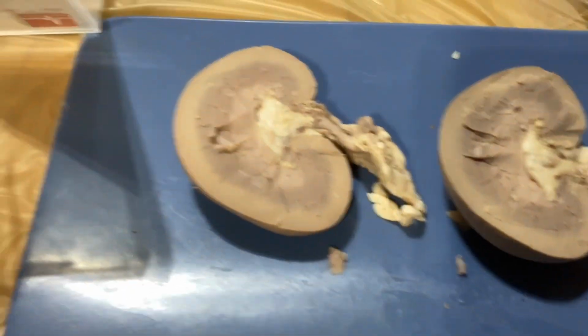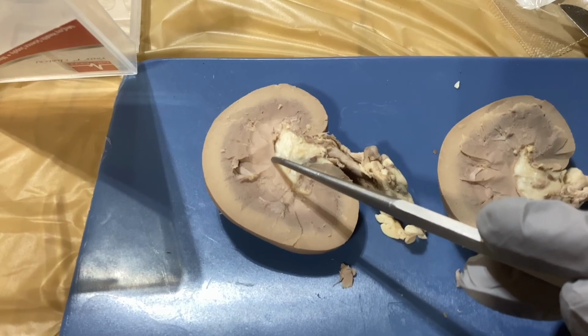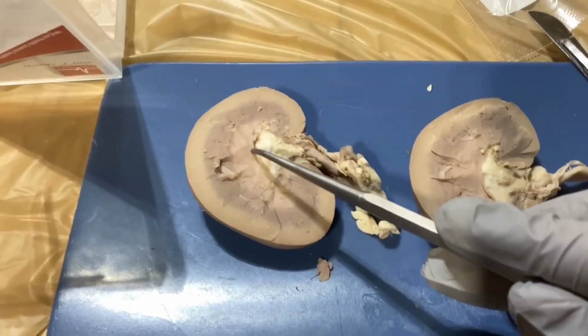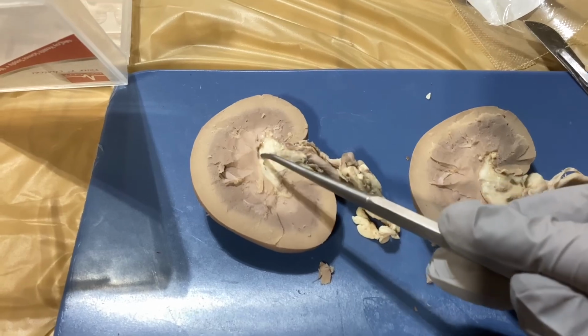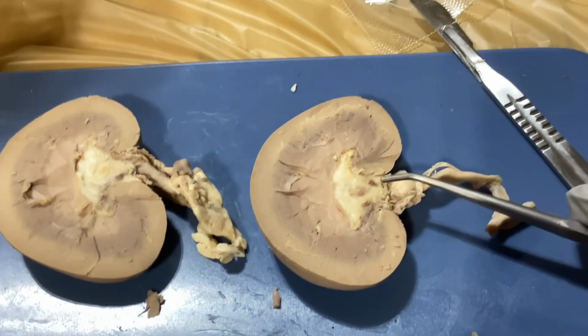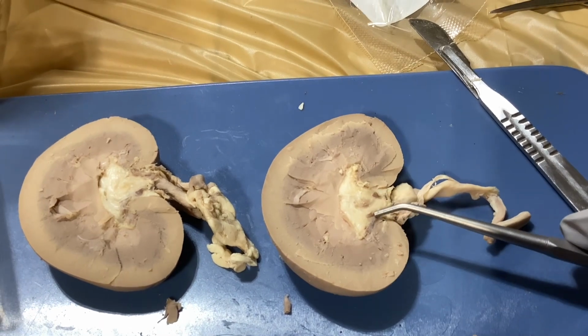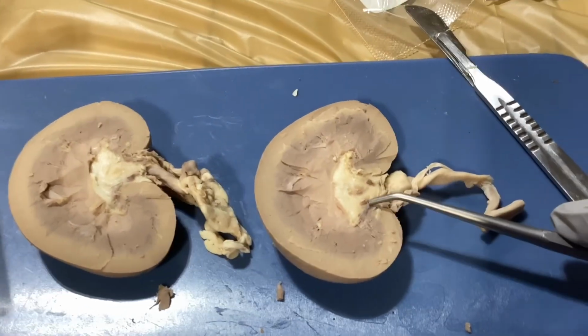Next, we have the renal papilla, which is going to be at the apex part of our pyramids. And then that's going to go into our minor calyx right here. So that's going to be at this little part right here from our pyramids. So next, we have the renal pelvis, and it's going to be by our major calyx, not cortex, major calyx. That's going to be right here on our kidney.